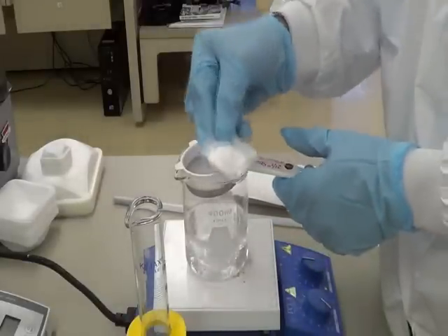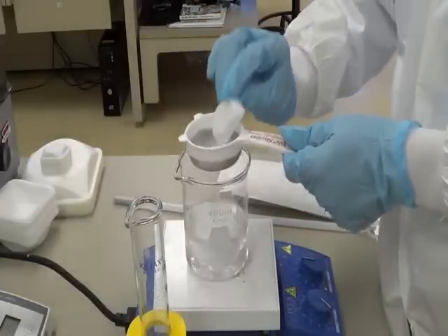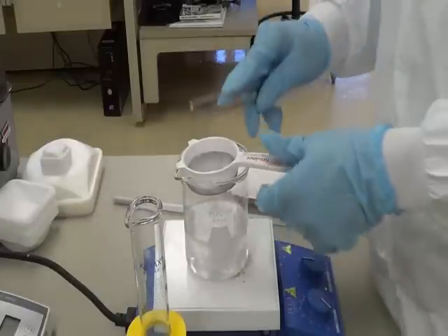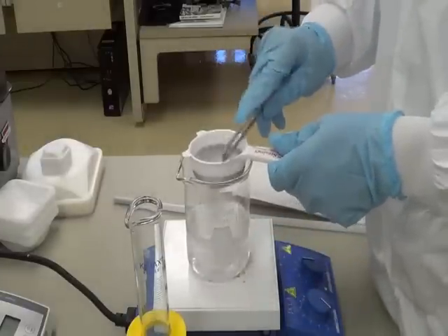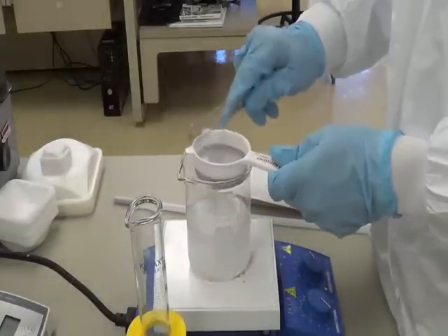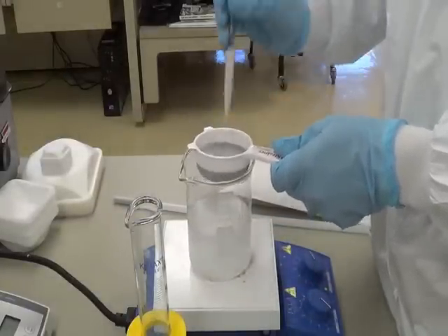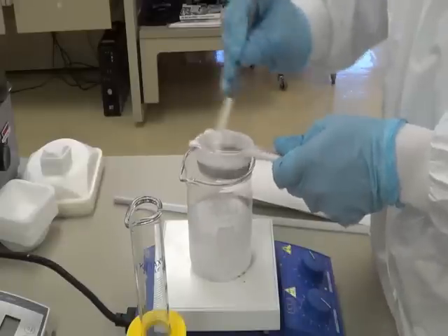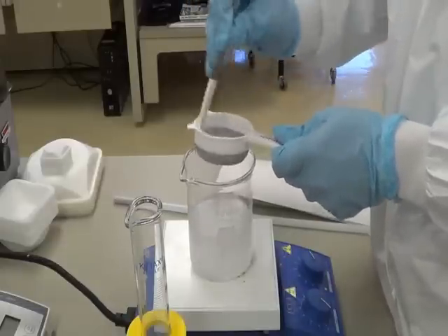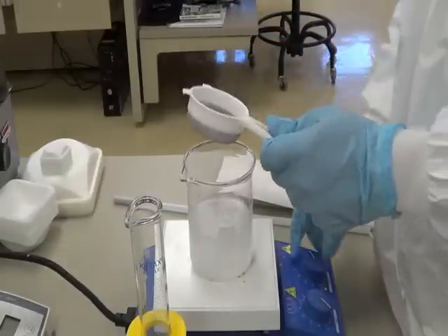This is the carbomer. I am going to transfer it into the sieve. What I am going to do is gently tap it in — the stir bar is at high speed. Now I have added all the carbomer.